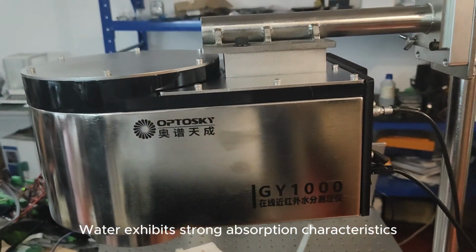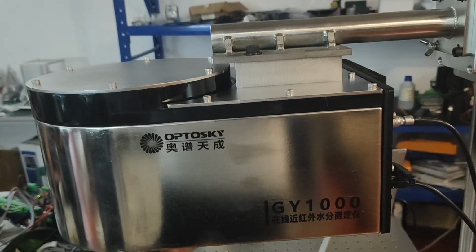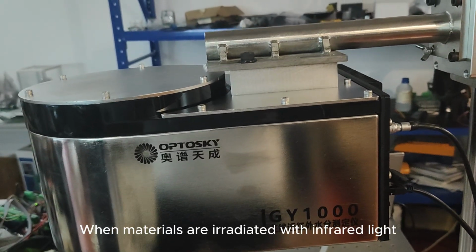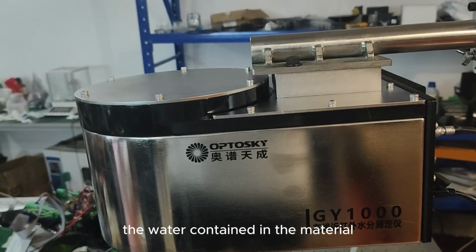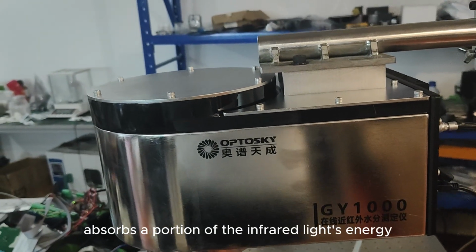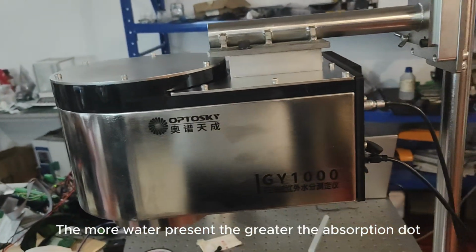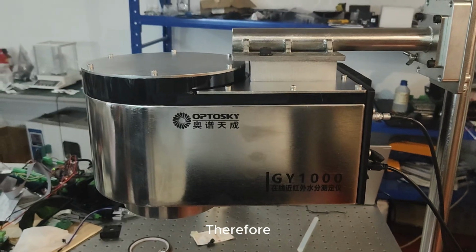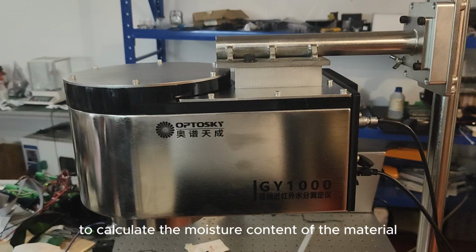Water exhibits strong absorption characteristics at certain specific wavelengths of infrared light. When materials are irradiated with infrared light at these specific wavelengths, the water contained in the material absorbs a portion of the infrared light's energy. The more water present, the greater the absorption. Therefore, the reduction in reflected light can be measured to calculate the moisture content of the material.